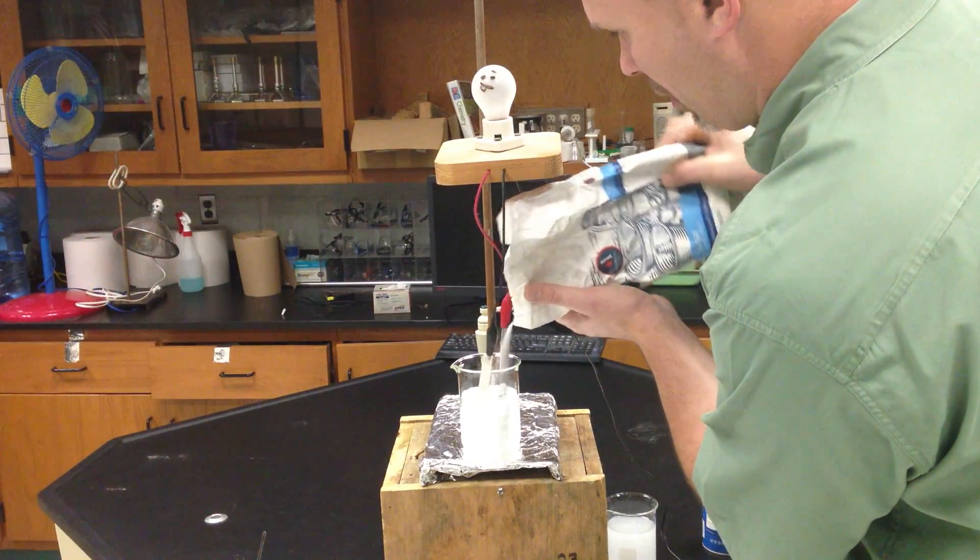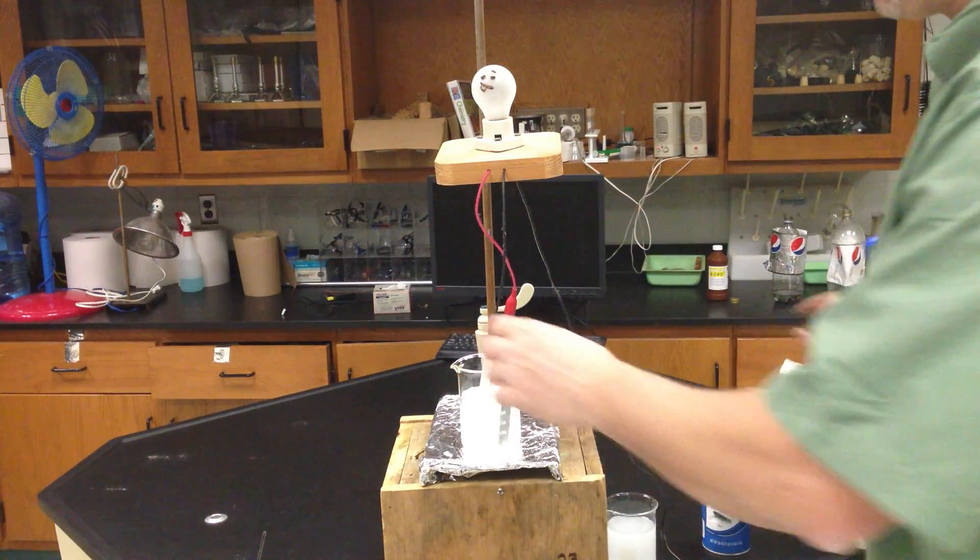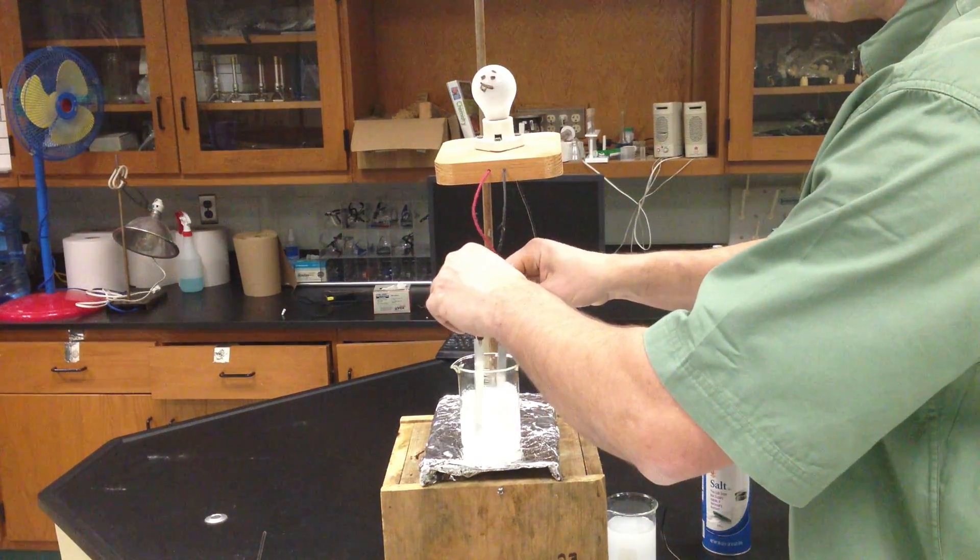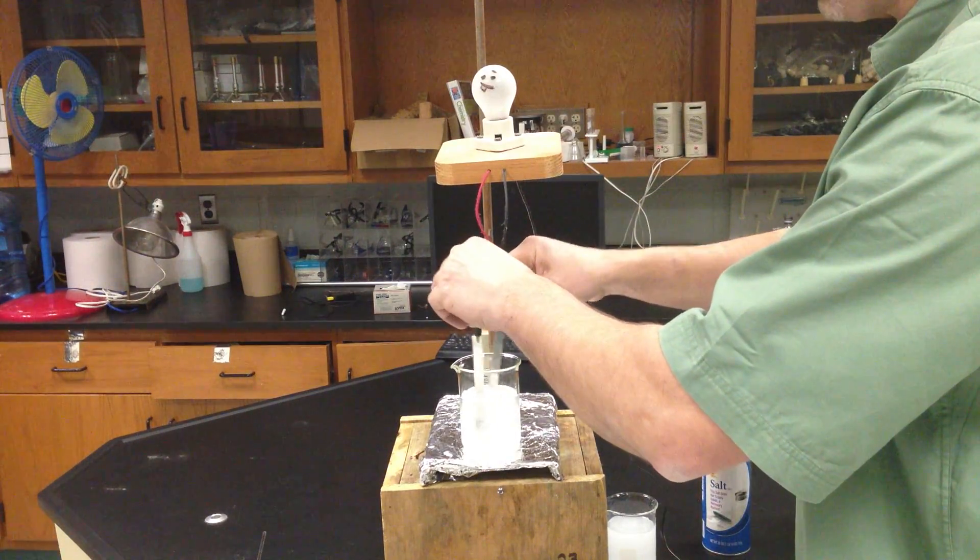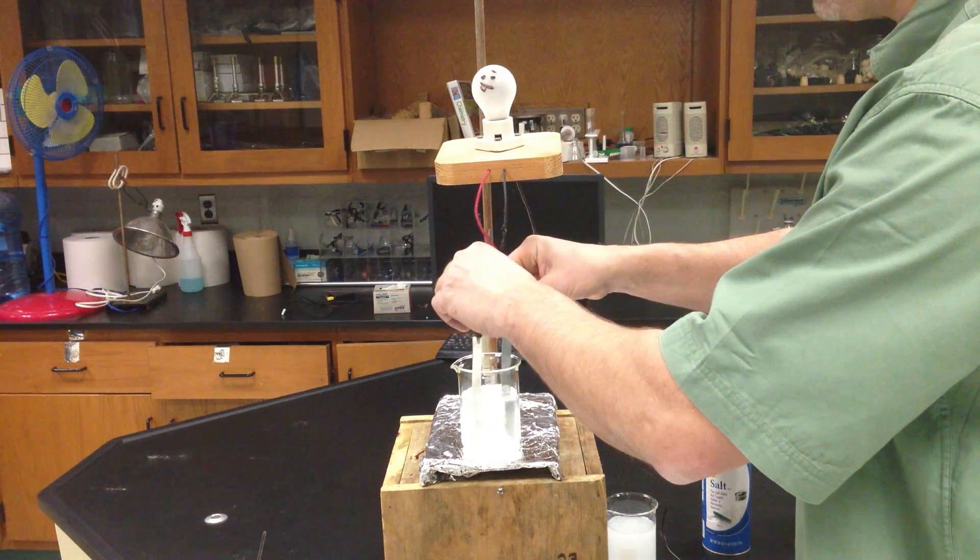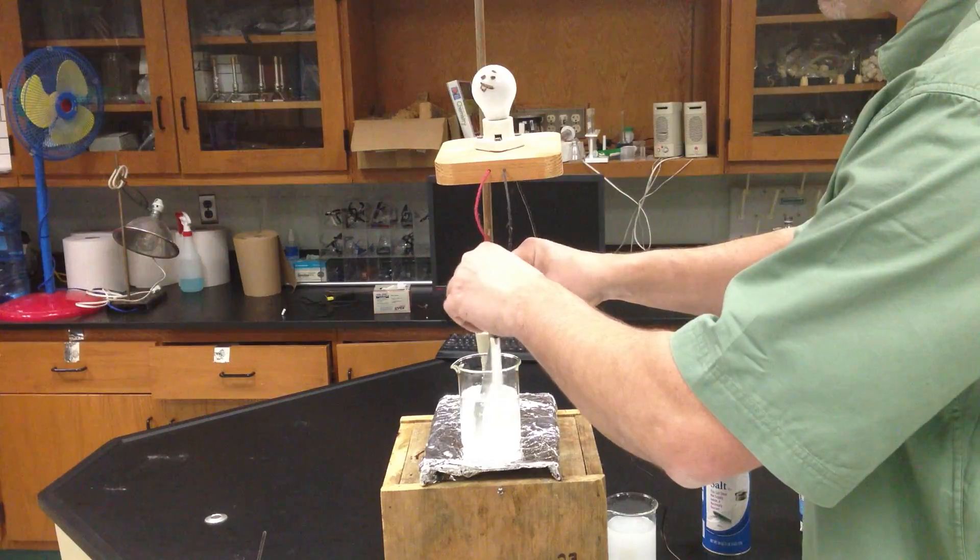And no matter how much sugar I put and dissolve, the sugar is not going to conduct because it's made up of non-metals. Non-metals do not break apart into ions, at least non-acids or bases. So therefore, this is never going to conduct.